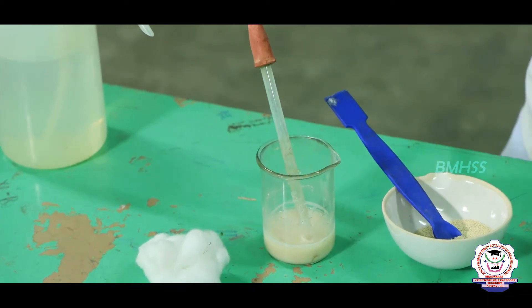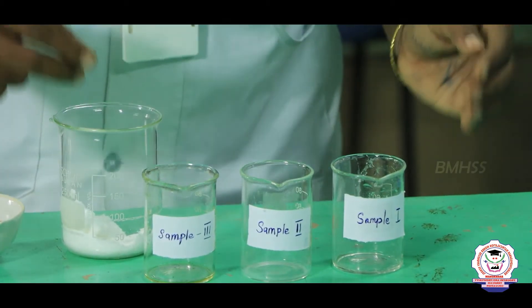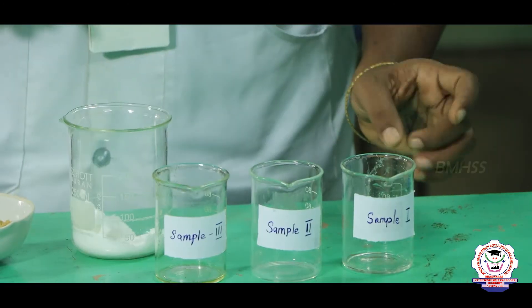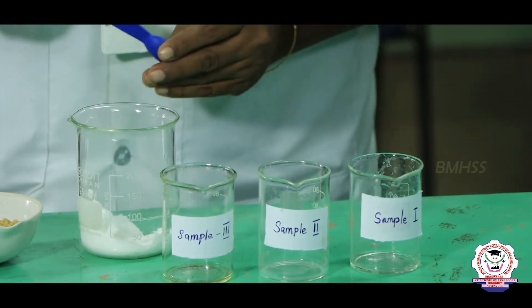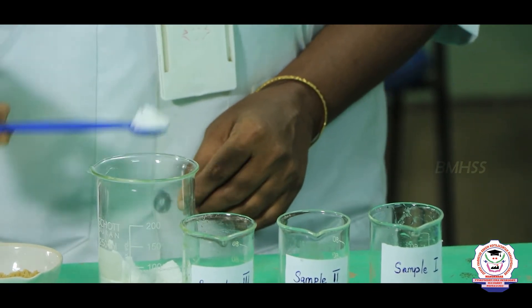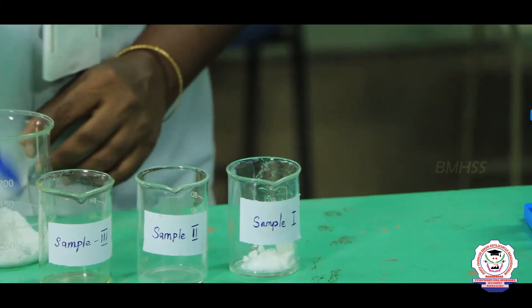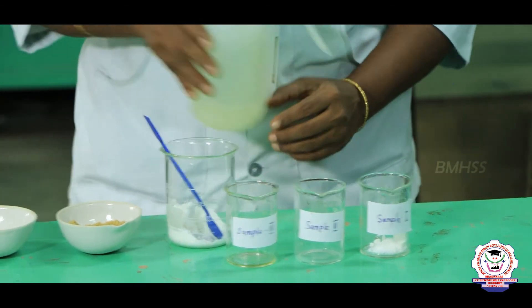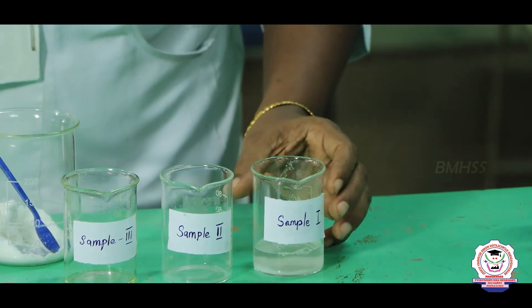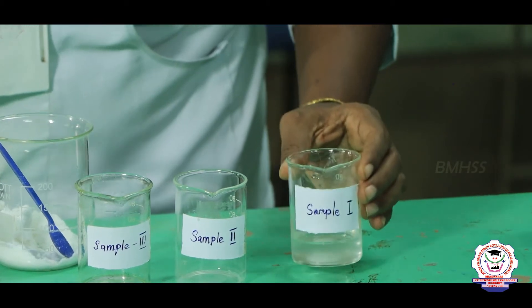Now we are going to start the experiment. The first thing is that we have to make the sample solutions ready — sample 1, sample 2 and sample 3. For sample 1 solution we are going to add the glucose powder with water. The sample 1, that is a glucose solution, is now ready.